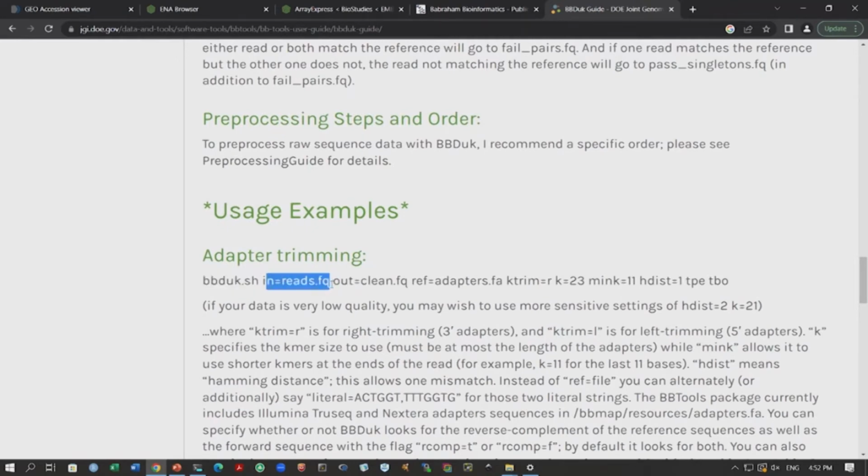We have in1, in2, because we have paired end data. We will use out1, out2, because we are dealing with paired end data. So, we will get 2 output files. Then you have something called ref=adapters.fa. This refers to the adapters file that is present within this folder. BBMap has its own adapter sequences stored. So, this contains a list of all adapters that are utilized by different platforms. So, these adapters can be then removed by this tool.